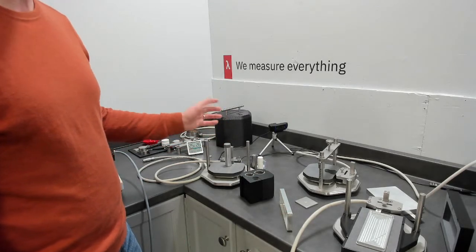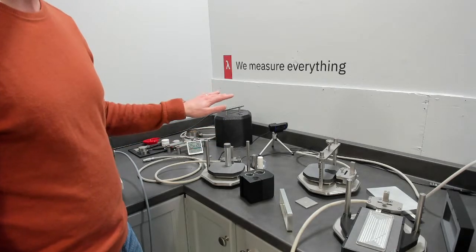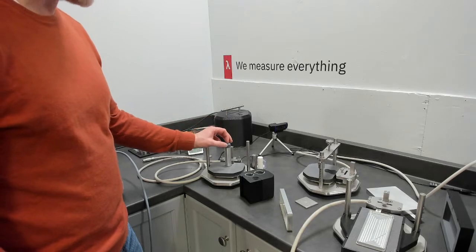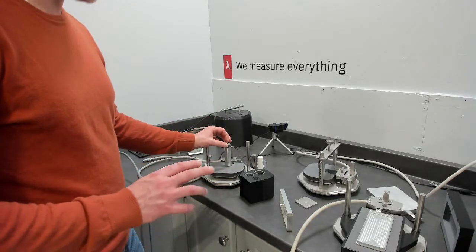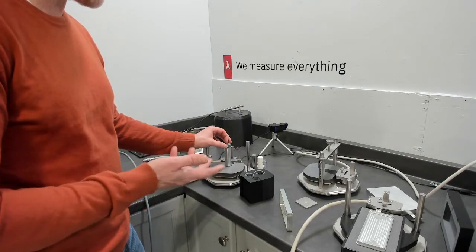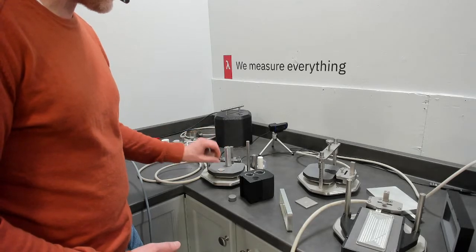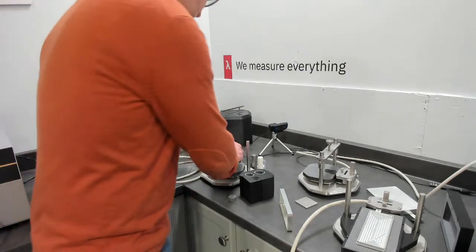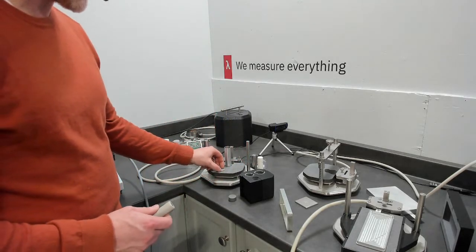I think we can go up to 70 or 80 millimeters in diameter and several heights, so we can accommodate most cylinder size batteries. We can also custom make cells to accommodate most battery dimensions. That would be your standard setup for specific heat on a cylinder.